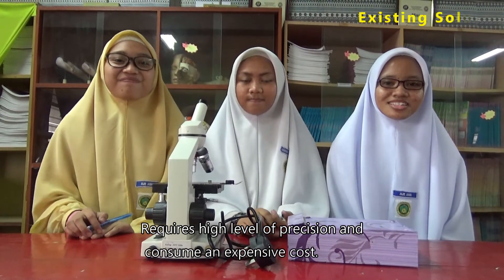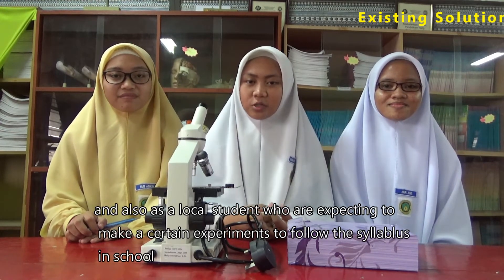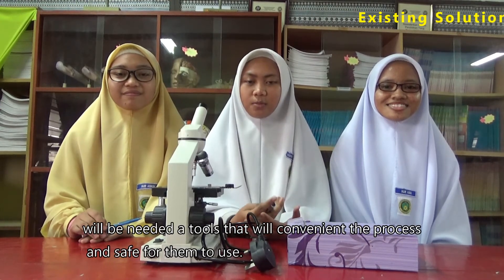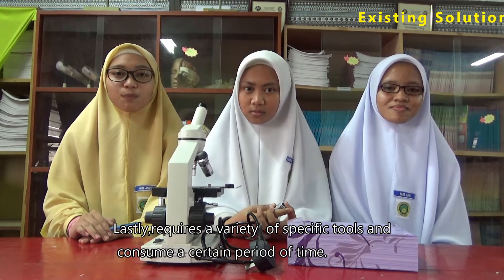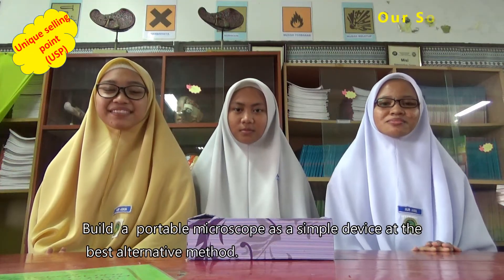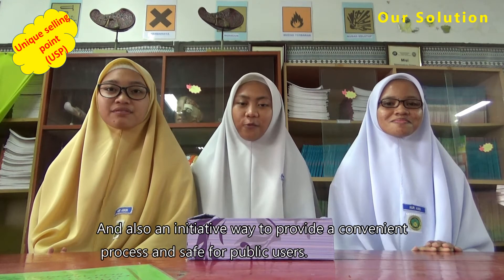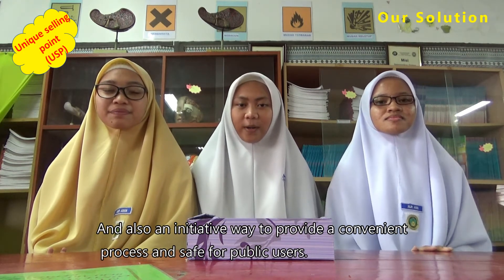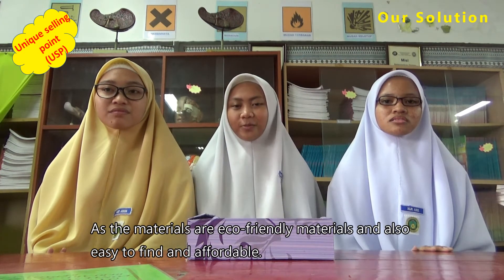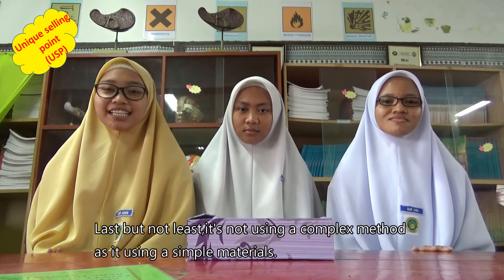Traditional microscopes require a high level of precision and consume expensive resources. Local students who are expected to make experiments to follow the syllabus in school will need a tool that is convenient and safe for them to use. Building a portable microscope as a simple device is the best alternative method, and also an initiative way to provide a convenient process that is safe for public users. The materials are eco-friendly, easy to find, and affordable. Last but not least, it does not use a complex method, as it uses simple materials.